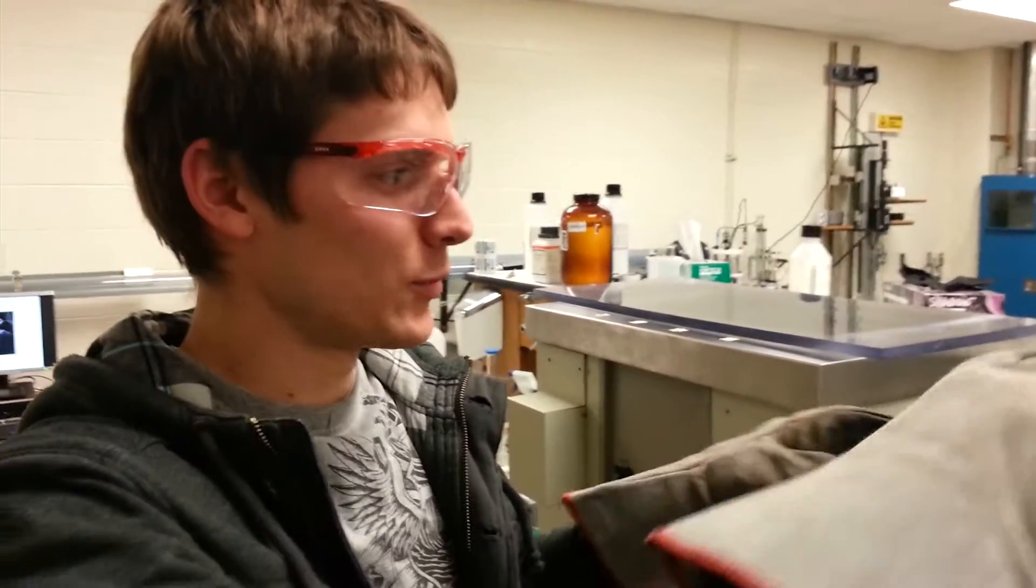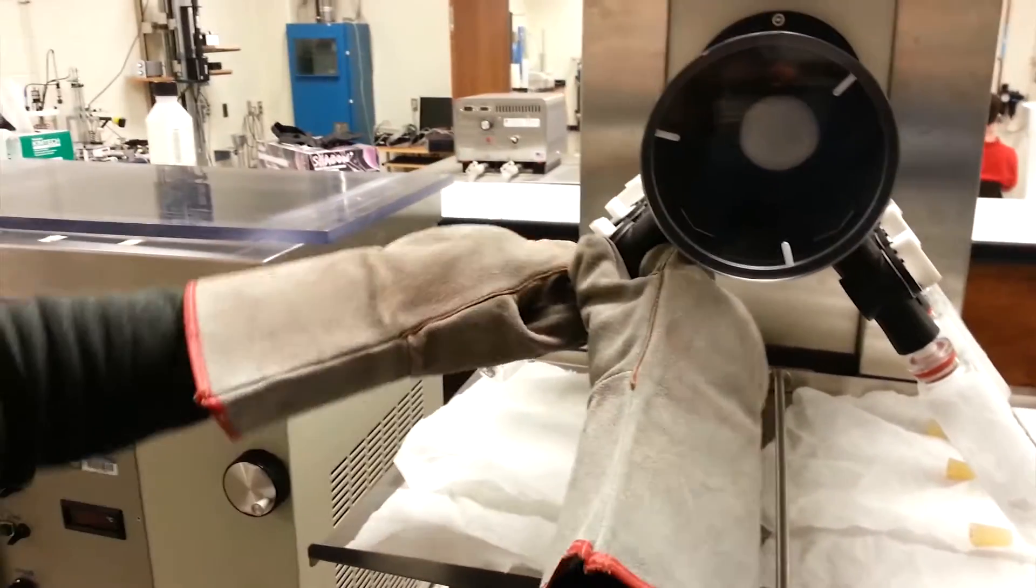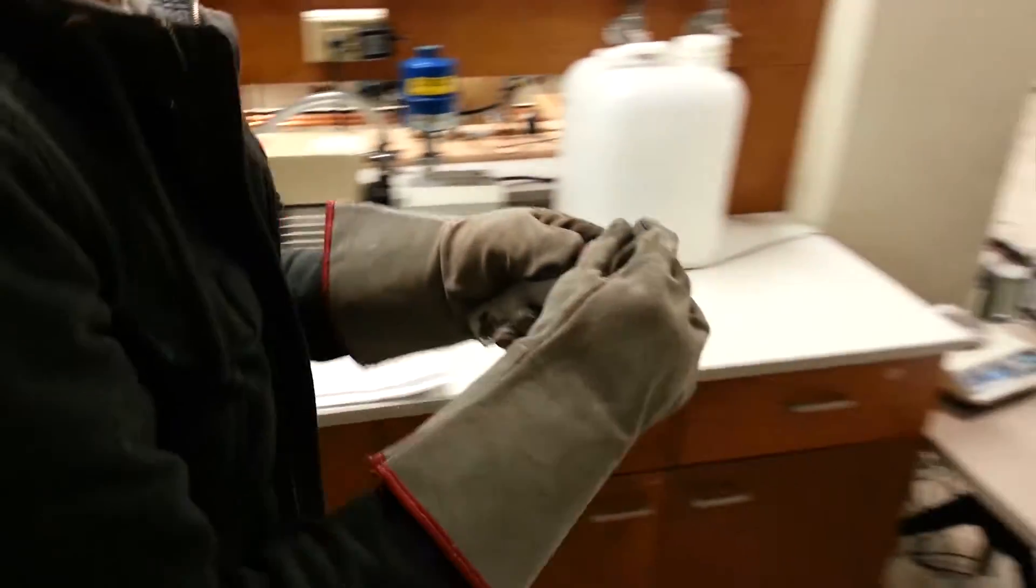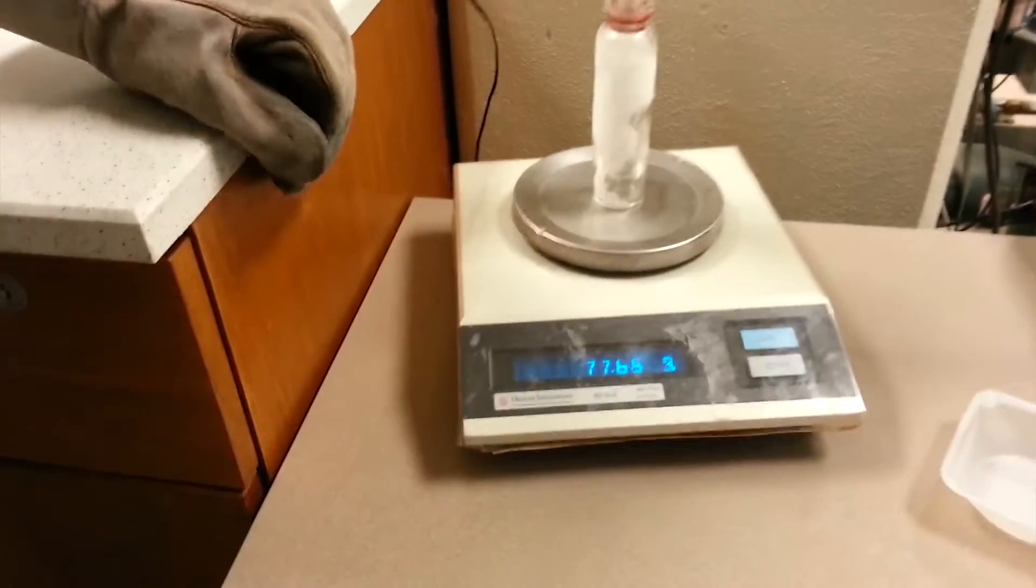If we take a data point, what we do is we're going to close it to the vacuum. We're going to pull off the sample and then we're going to weigh it so that we can measure how much water has been dried, taken out.